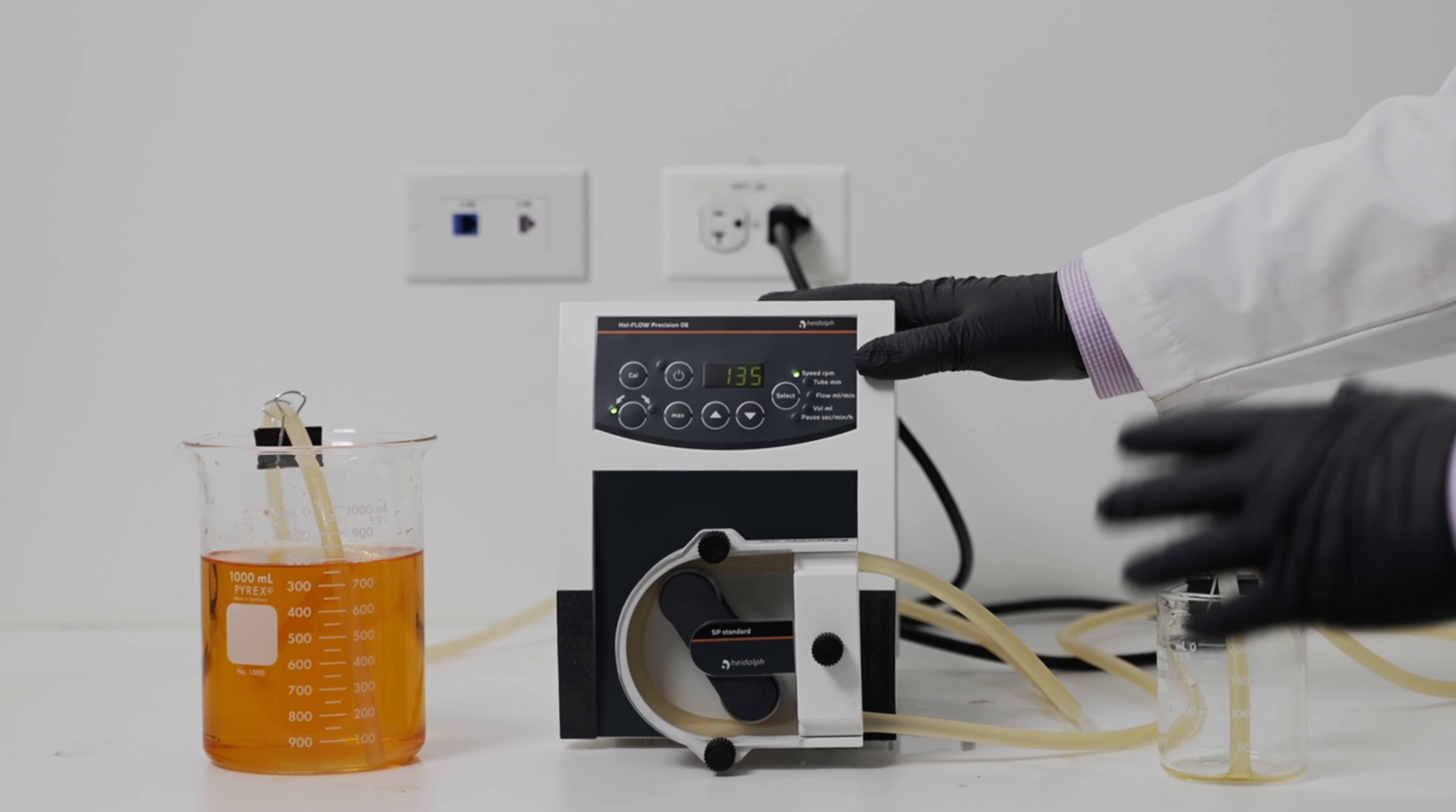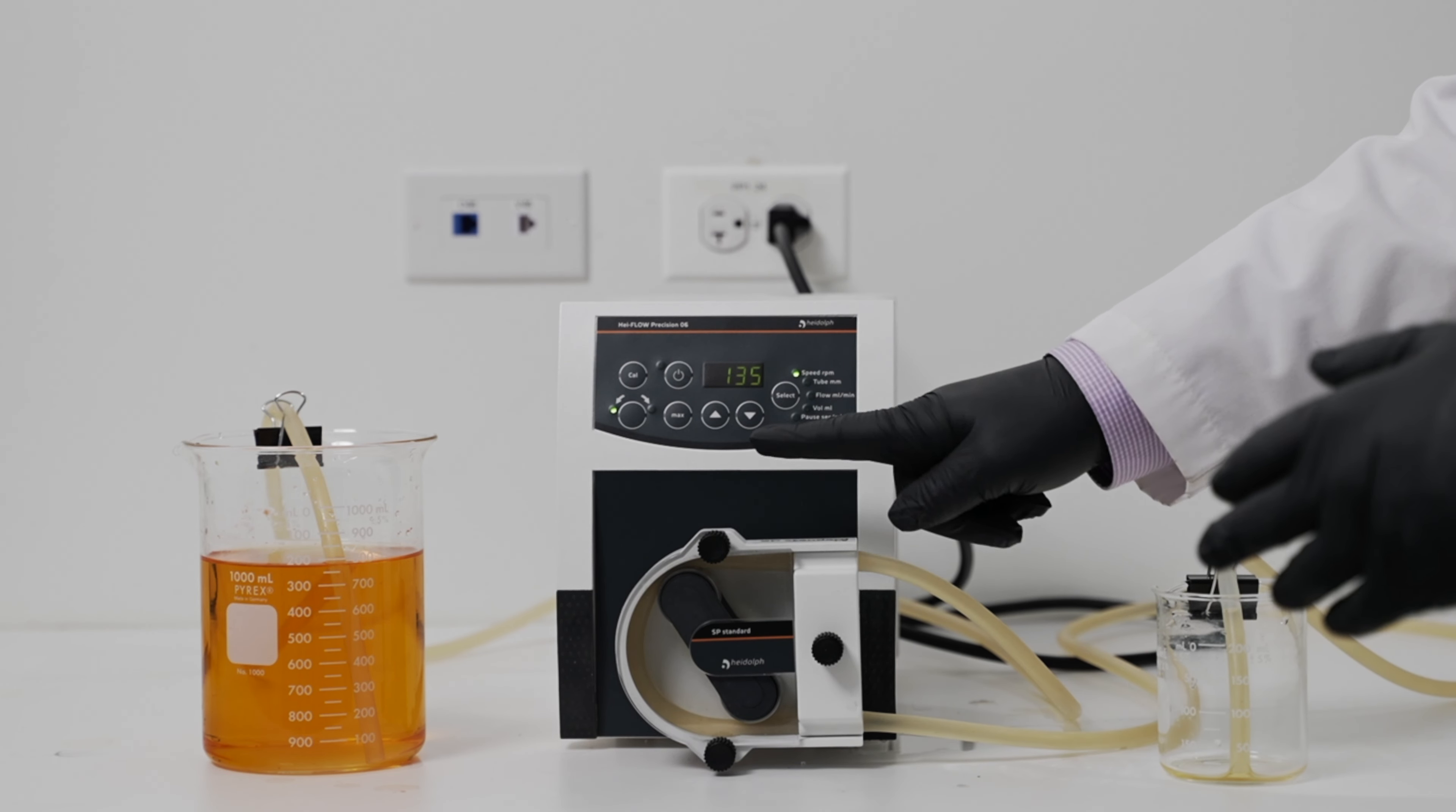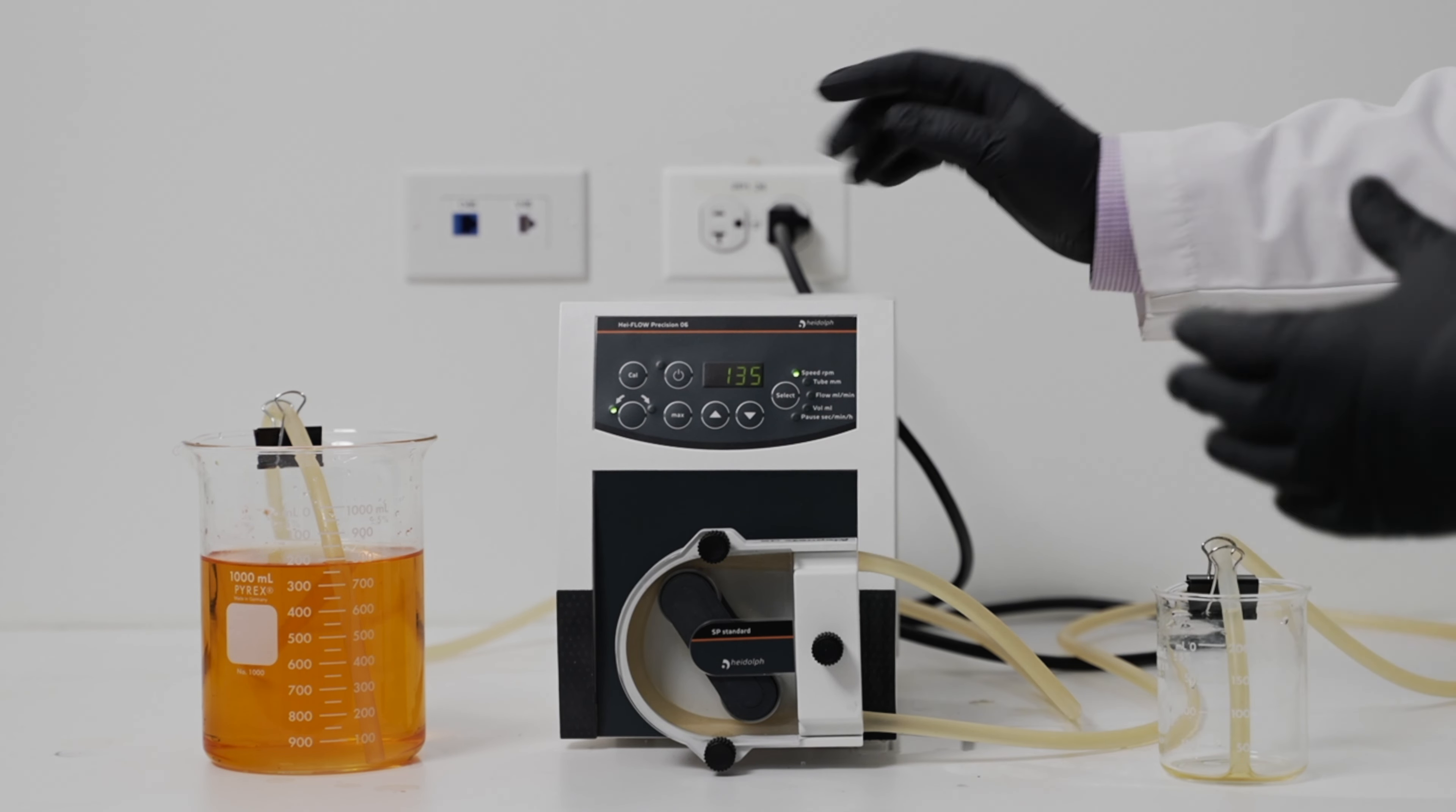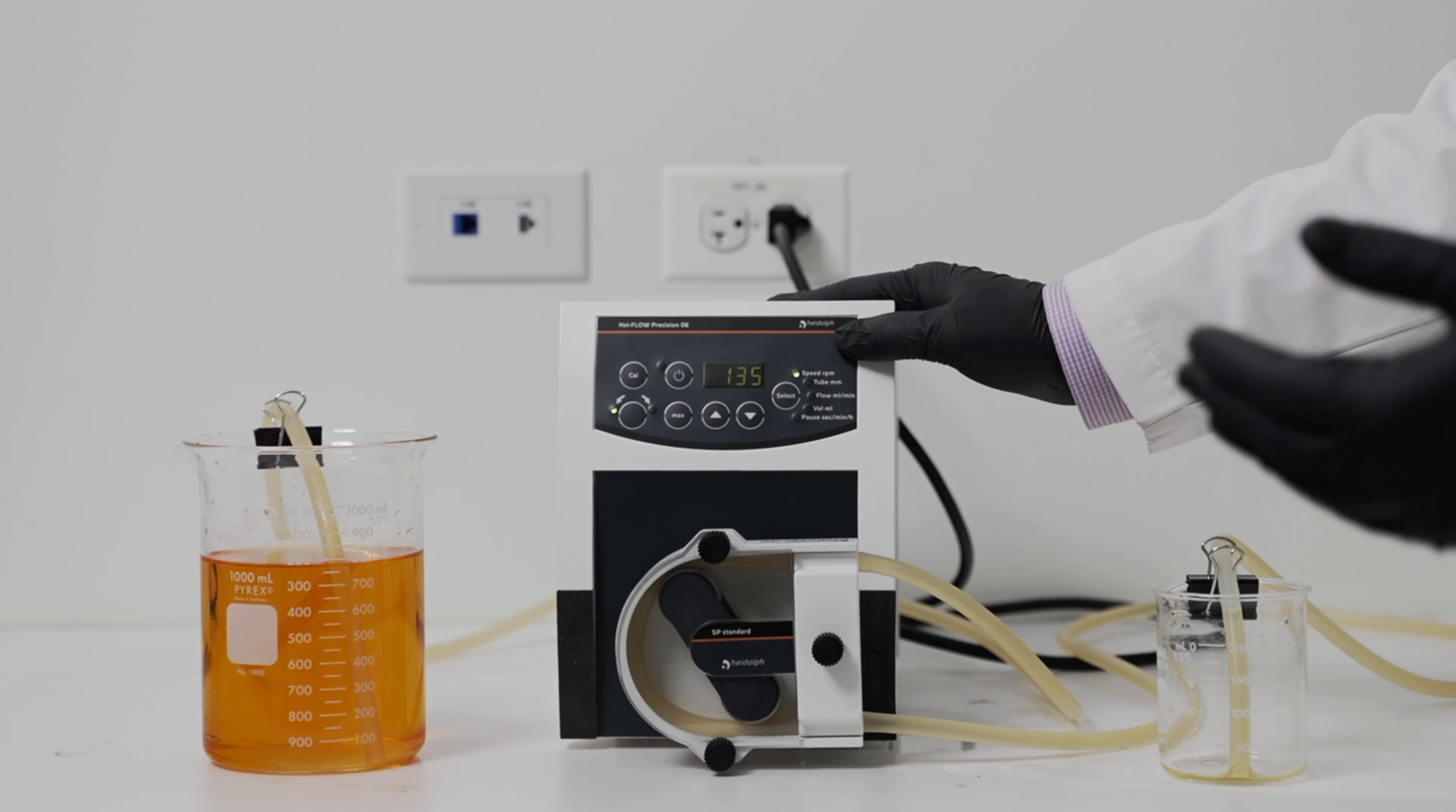Before calibrating your peristaltic pump, you want to do two things. The first is to make sure your peristaltic pump and your peristaltic pump head are synced. In order to do that, you can follow our video on syncing your peristaltic pump head to your peristaltic pump.